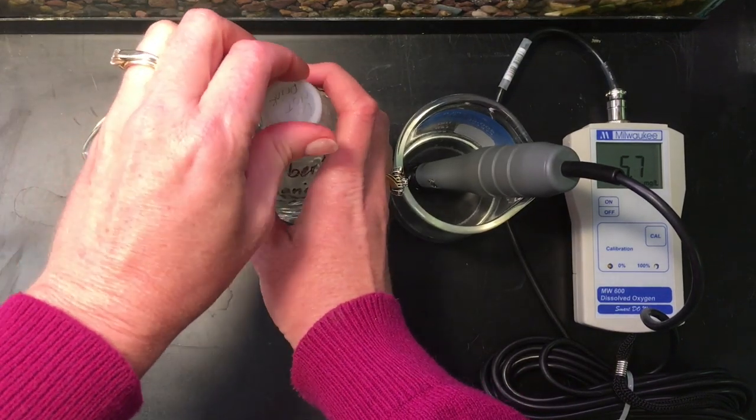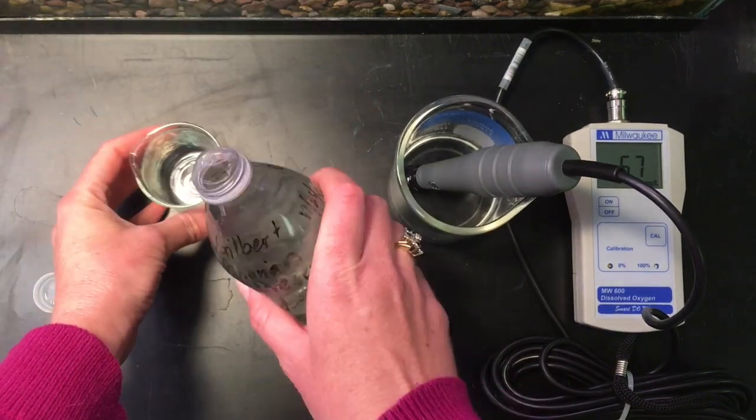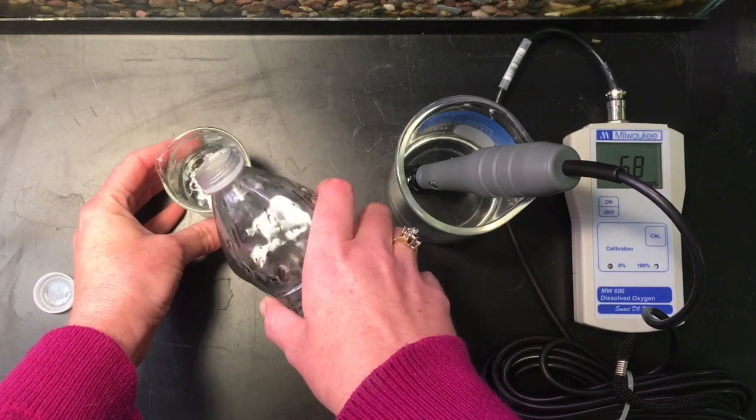And I'm going to take this sample, pour it in a beaker so it will make it easier to measure.